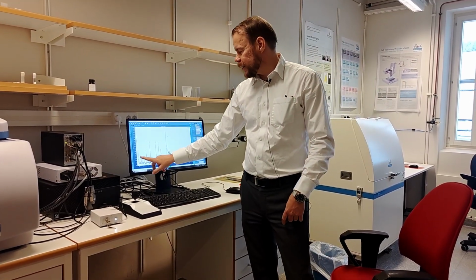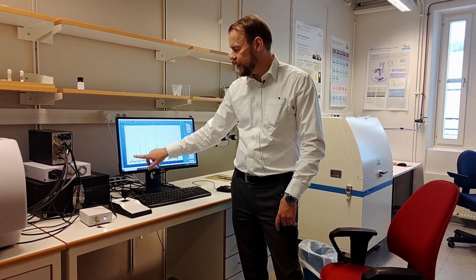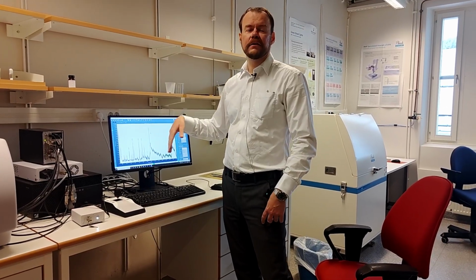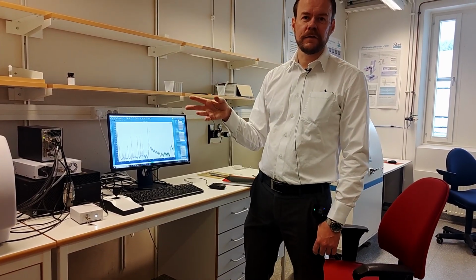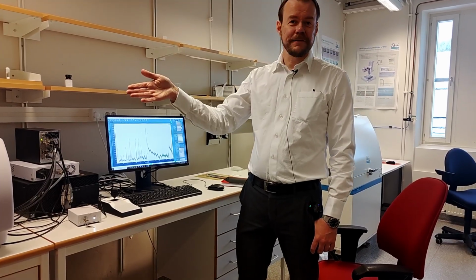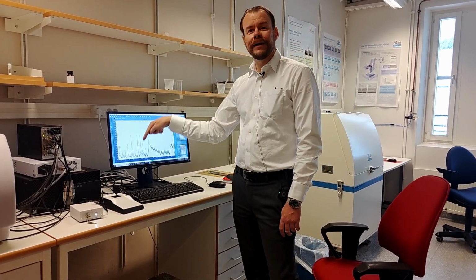That means the signals will still be the same, but that background will rise, so you see some peaks here, and then everything will just come under that baseline. So that's why you cannot use it if there's fluorescence. So there are 2 ways around that. Either you switch laser wavelength, and we can't do that on this machine, or you need to decrease scan time.